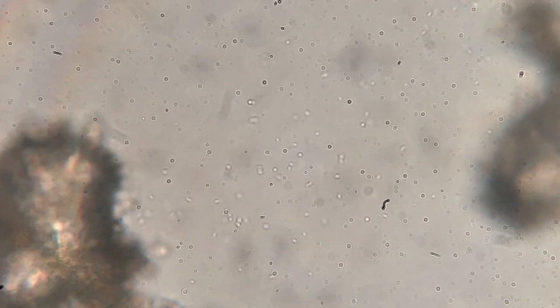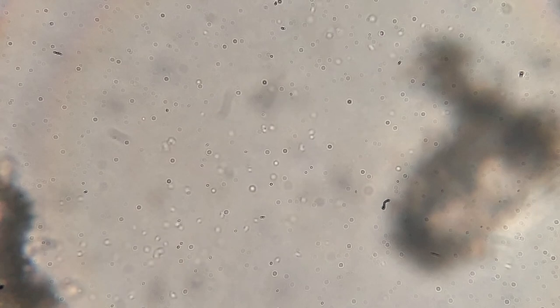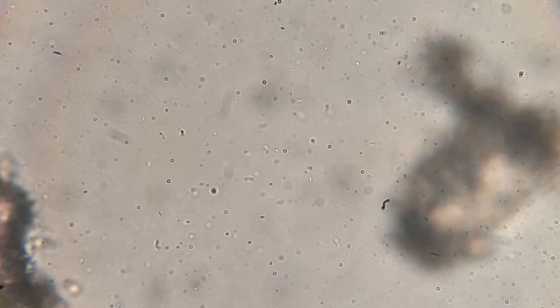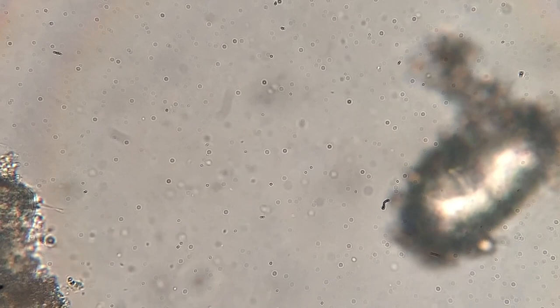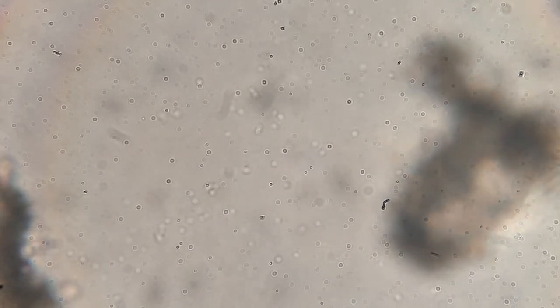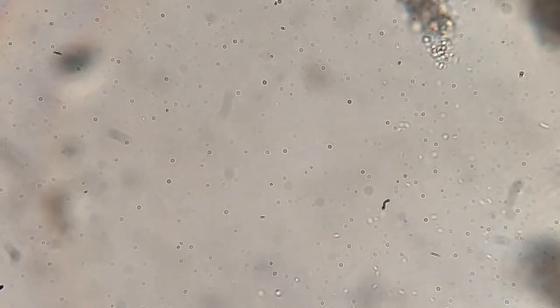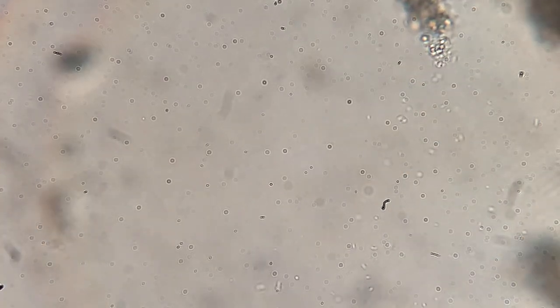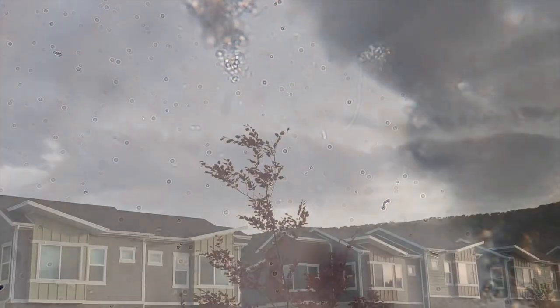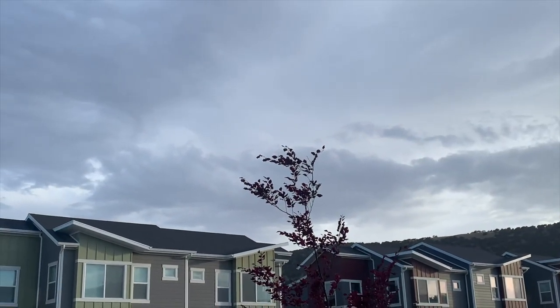As one last honorable mention, these are some bits of bacteria that you can see under the microscope. I saw a bunch of these as well, but they were too small — I need to get a larger objective lens to see these guys up close. Bacteria are the OGs. They've been around, along with archaea, for the longest time, and they've probably been traveling by rain for about 3 billion 700 million years.